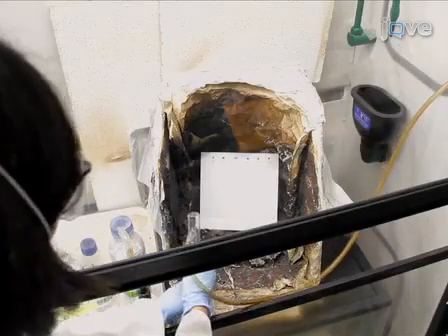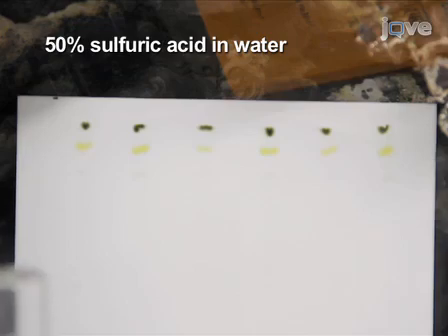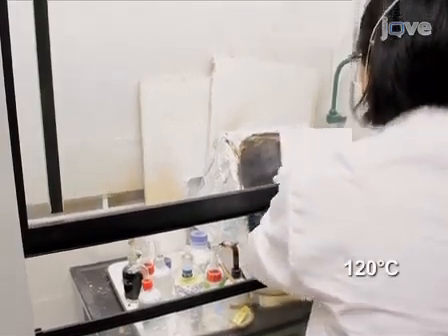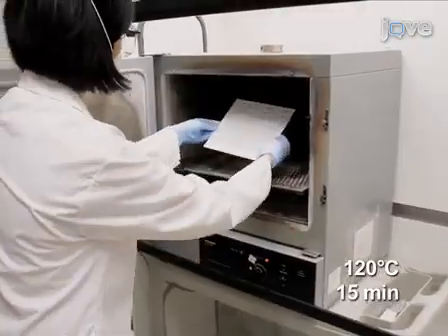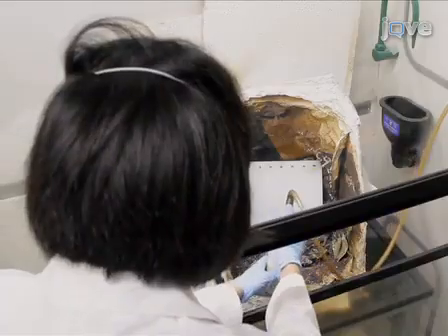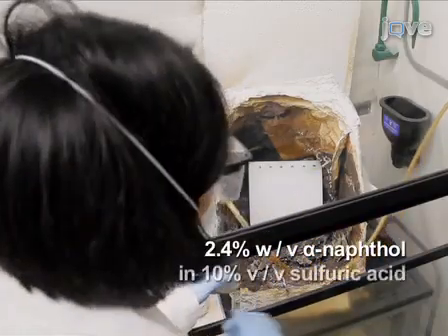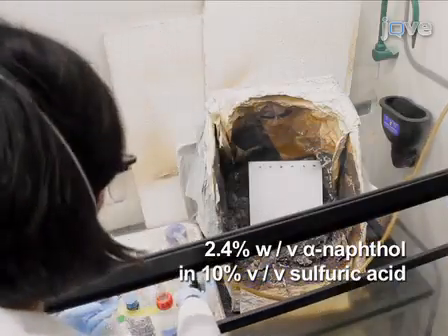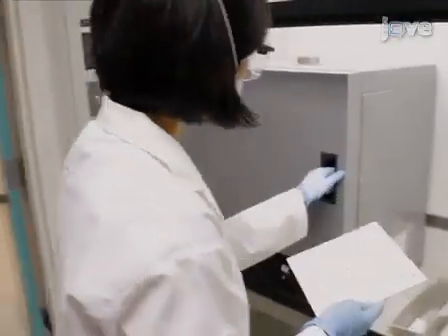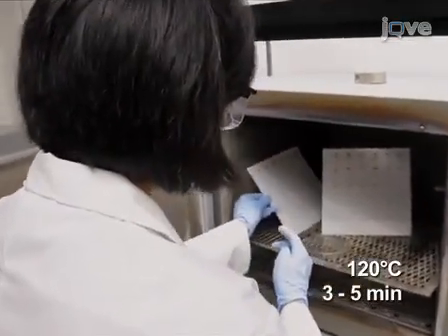To irreversibly stain the plate through sulfuric acid charring, spray the plate with 50% sulfuric acid in water in a glass spray bottle in the fume hood and bake at 120 degrees Celsius for 15 minutes. Conversely, when alpha-naphthol staining for glycolipids, spray the plate with 2.4% weight over volume alpha-naphthol in 10% volume over volume sulfuric acid, 80% volume over volume ethanol. Bake the plate at 120 degrees Celsius for 3 to 5 minutes until glycolipid spots are stained pink or purple.